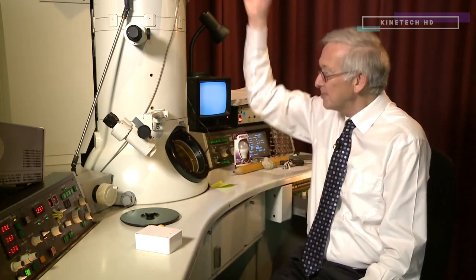The electrons are travelling incredibly fast — if you pointed this column at the moon, the electrons would get there in a few seconds. So they zip through the specimen. There are lenses above which focus the electrons onto the specimen, and then after the specimen there are more lenses which magnify the image of the specimen. On the screen you can get an image which is magnified 10 million times. We start by looking at lower magnification and then work up in magnification to see really the atoms, or almost atomic resolution, on the screen.